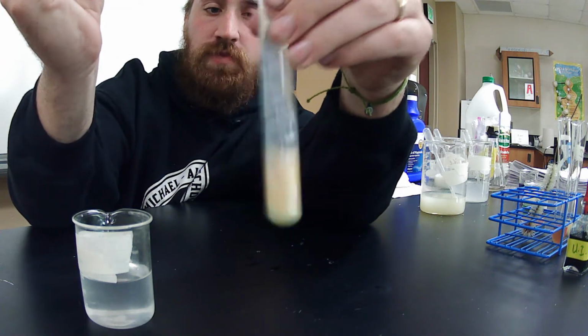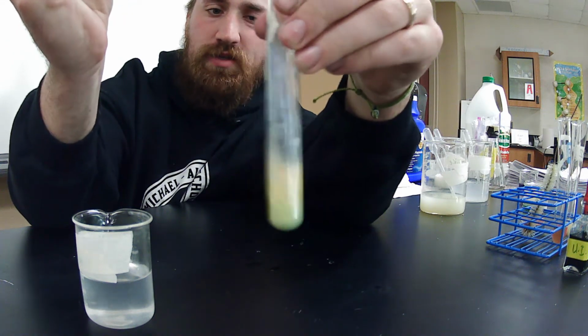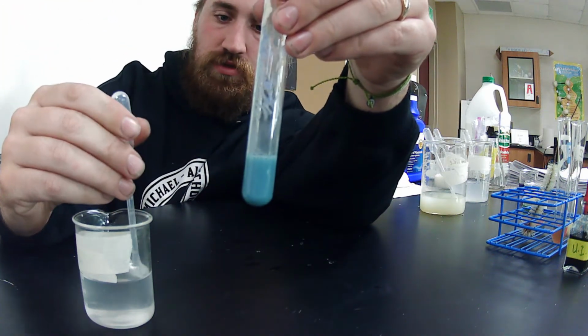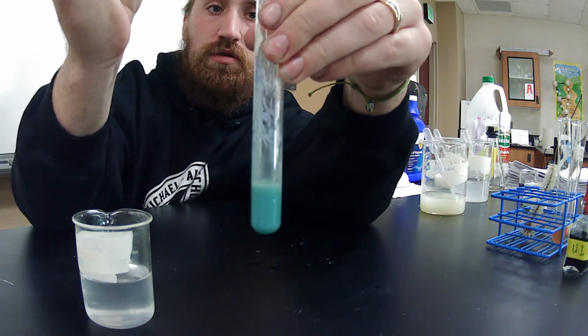Keep adding. Shaking. Oh, it keeps going back, but it's getting a little bit longer. Add, shake. Okay, keeps going. Add, shake. Okay, it's getting closer. Let's keep going. Do it again.